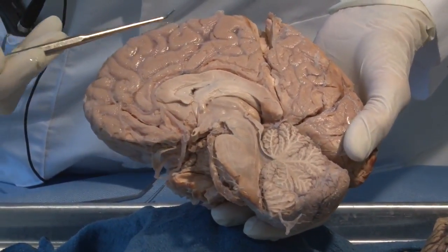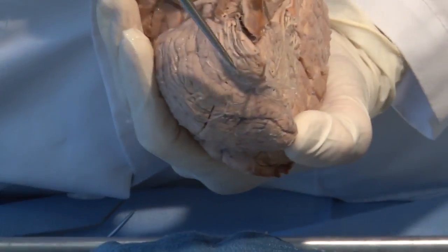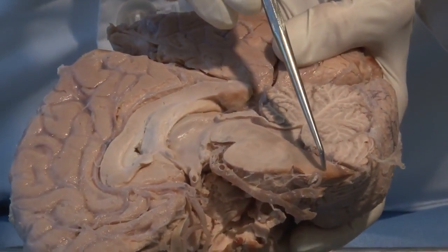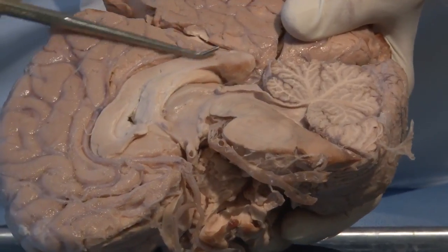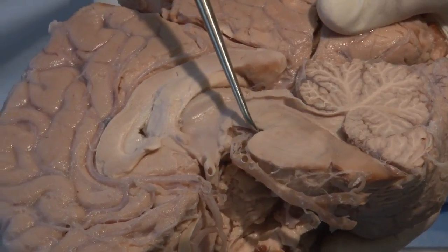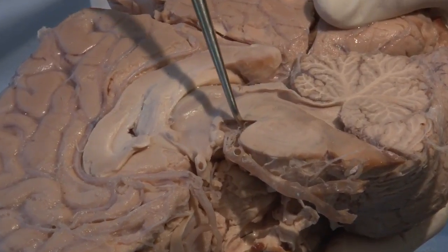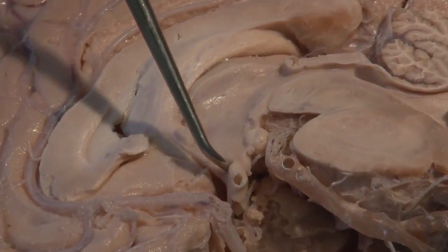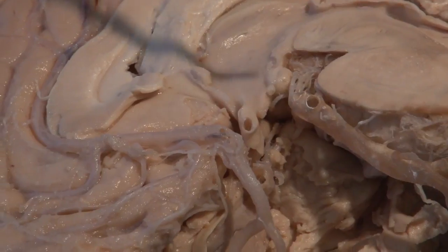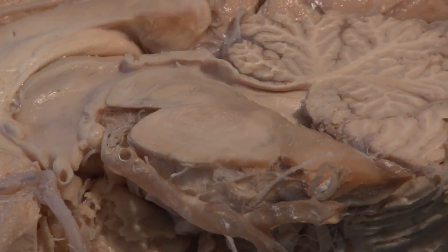The main thing I want you to see on this brain is the brainstem. So this is the cerebellum that we saw before out to the side, and the brainstem, recall, was in the middle. Here we have the brainstem on a mid-sagittal section. This is cut in the middle. Here's a bit of the medulla. Here is the pons with a big basilar artery creeping up over it. And here is the midbrain, often hard to see. And finally, then we have deep structures such as the thalamus. And we can see many of the vessels like the anterior cerebral artery here, as well as spaces such as the ventricular system, which we'll look at in more detail.